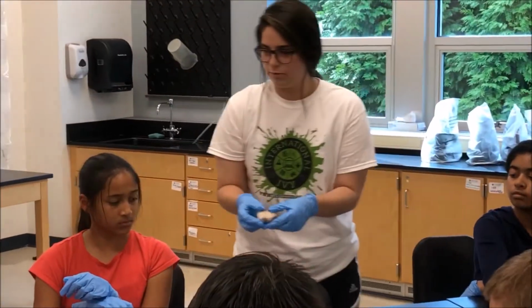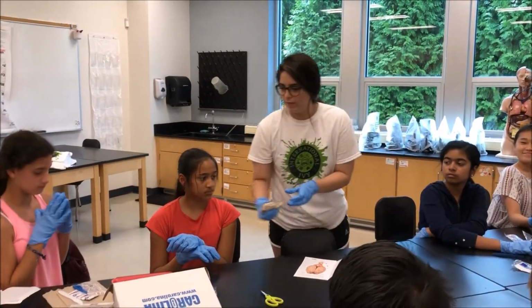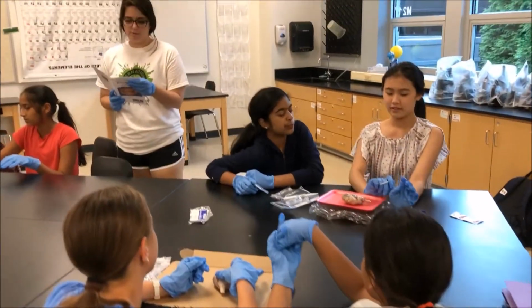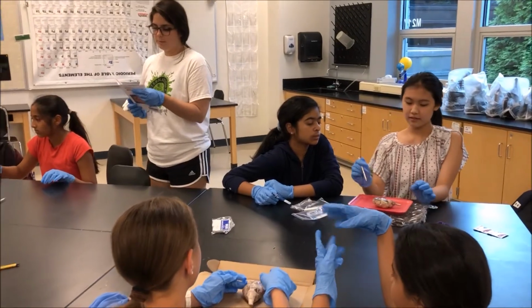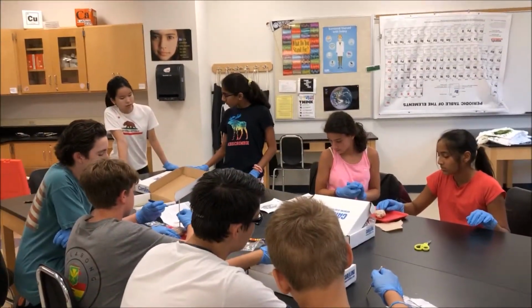Left hemisphere of the brain. This area is the cerebrum, and that's where we have our different lobes. The brainstem only goes about halfway across the brain. The posterior portion of the brainstem, including the cerebellum, is called the hindbrain.